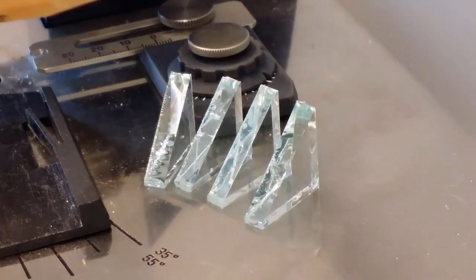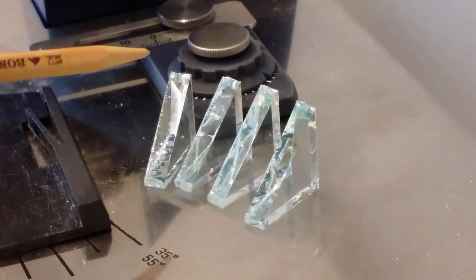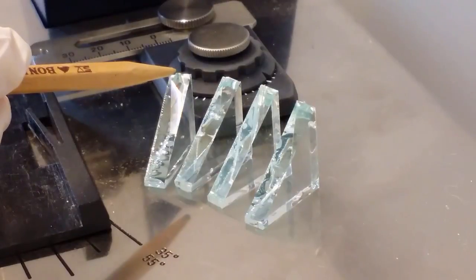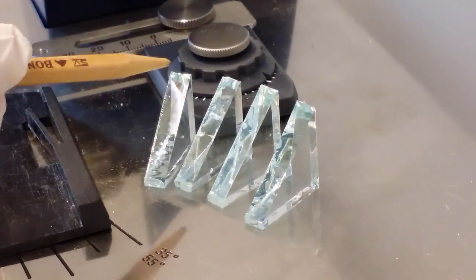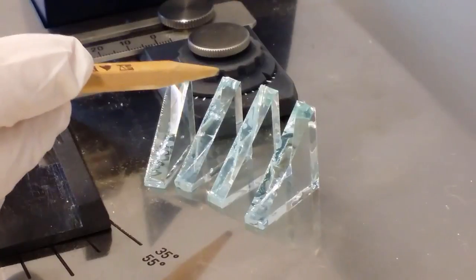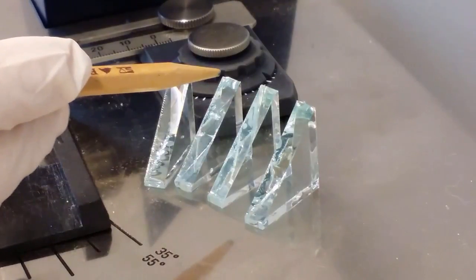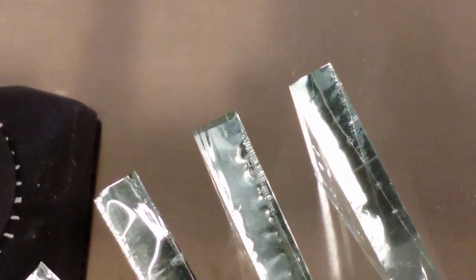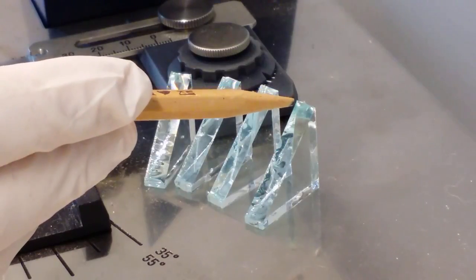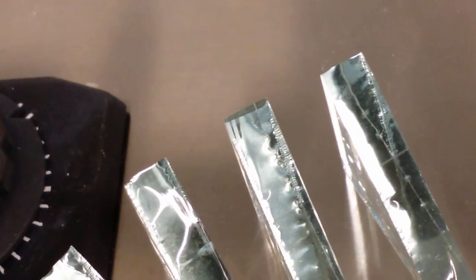Here you can see four cut knives. The first one is not good enough. It has some cracks in the top here of the edge. The second one looks uneven, and that's also bad. The third one you see doesn't have a sharp edge. It's actually flat on top here, so that's been cracked in the wrong way. The fourth one however is very good. That has a nice clean sharp edge. This can be used for cutting.